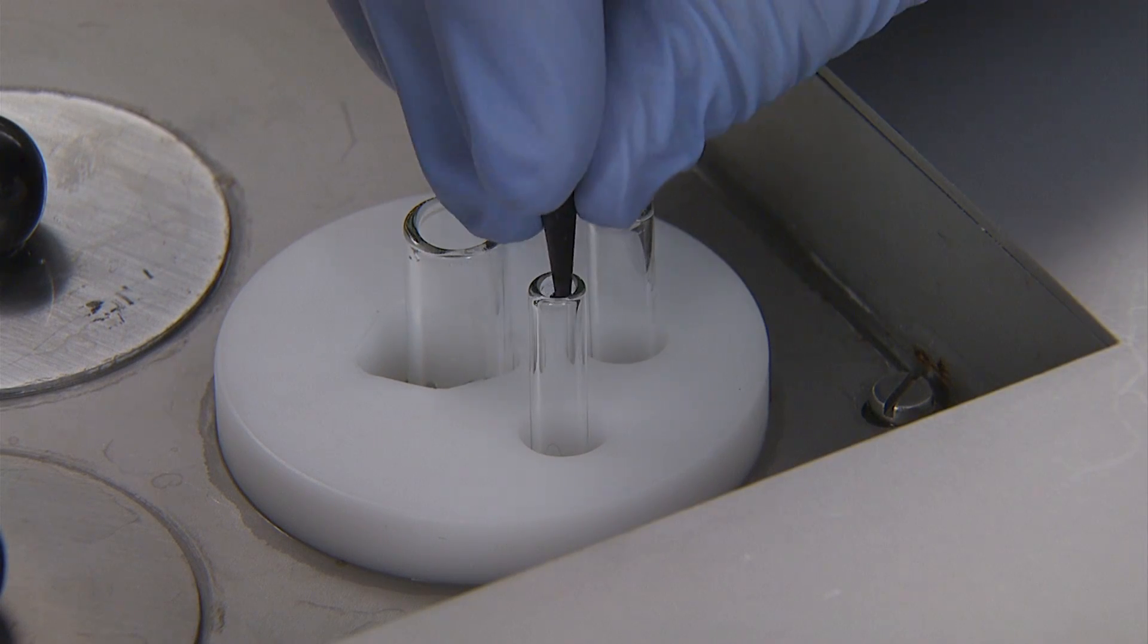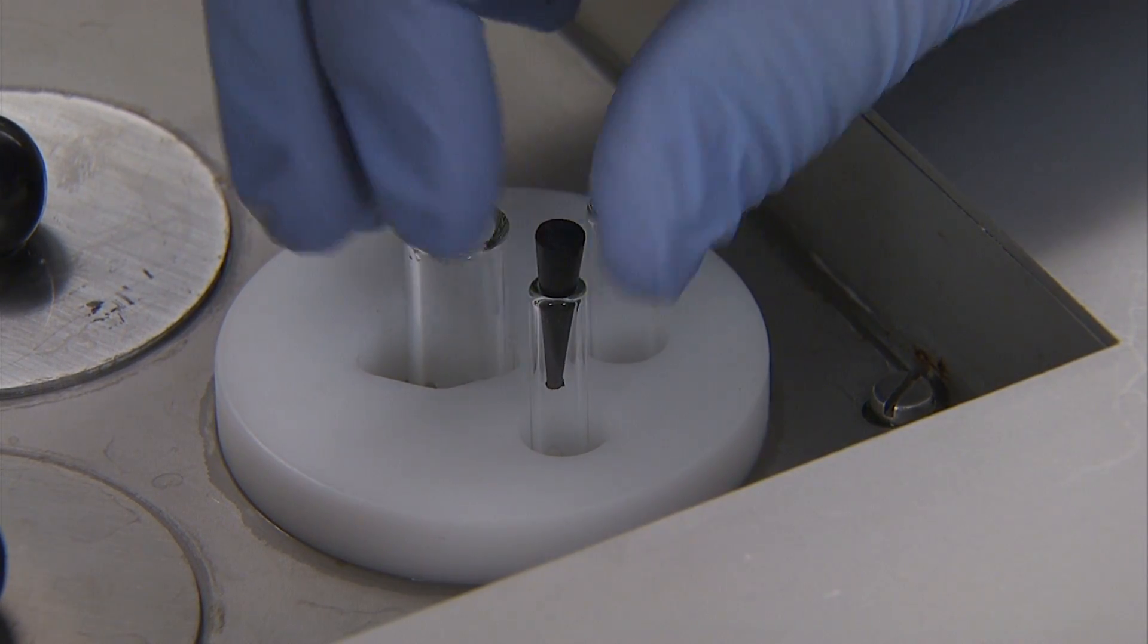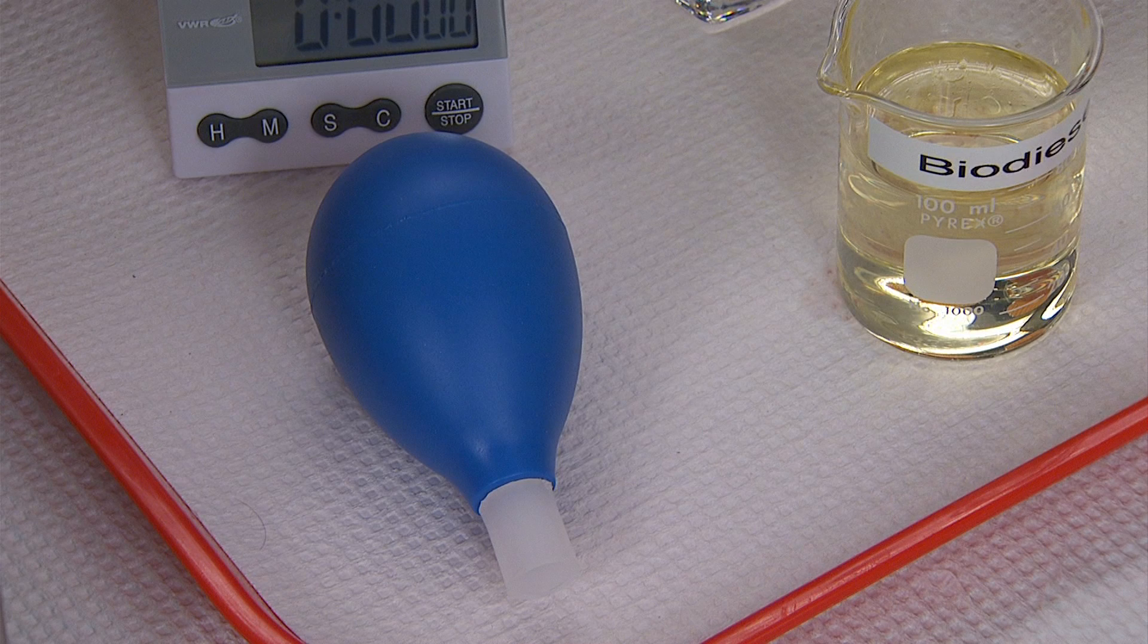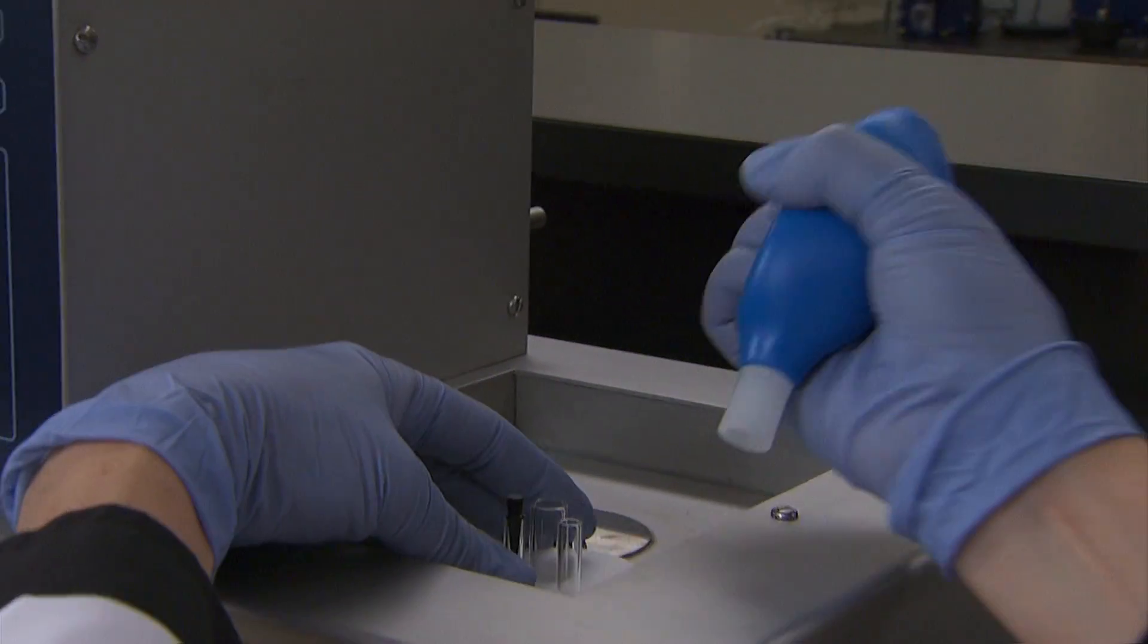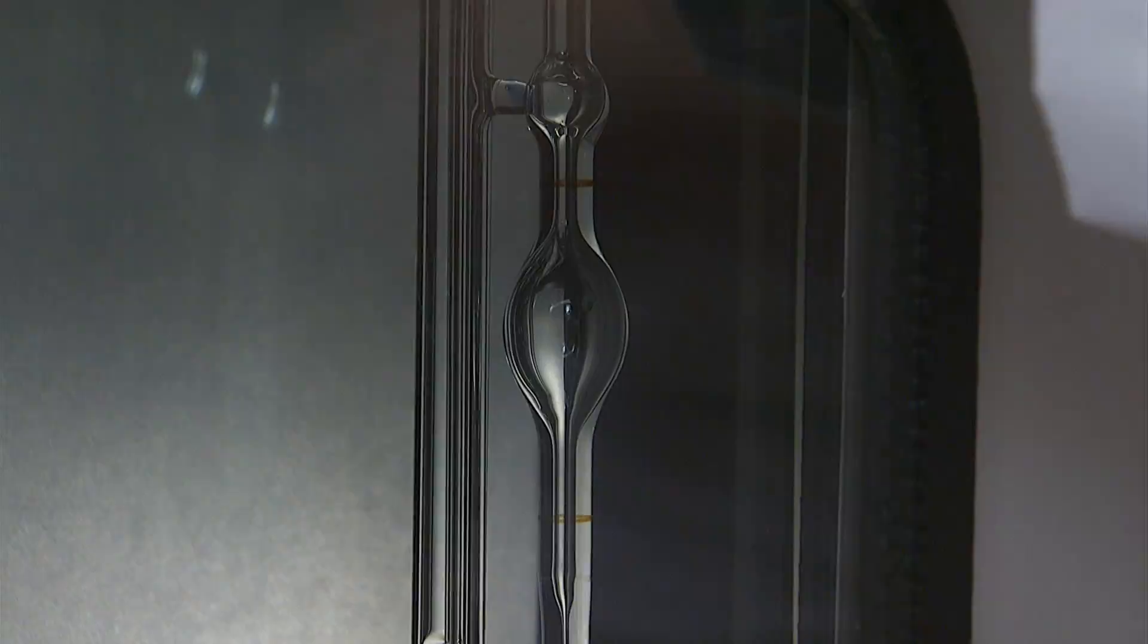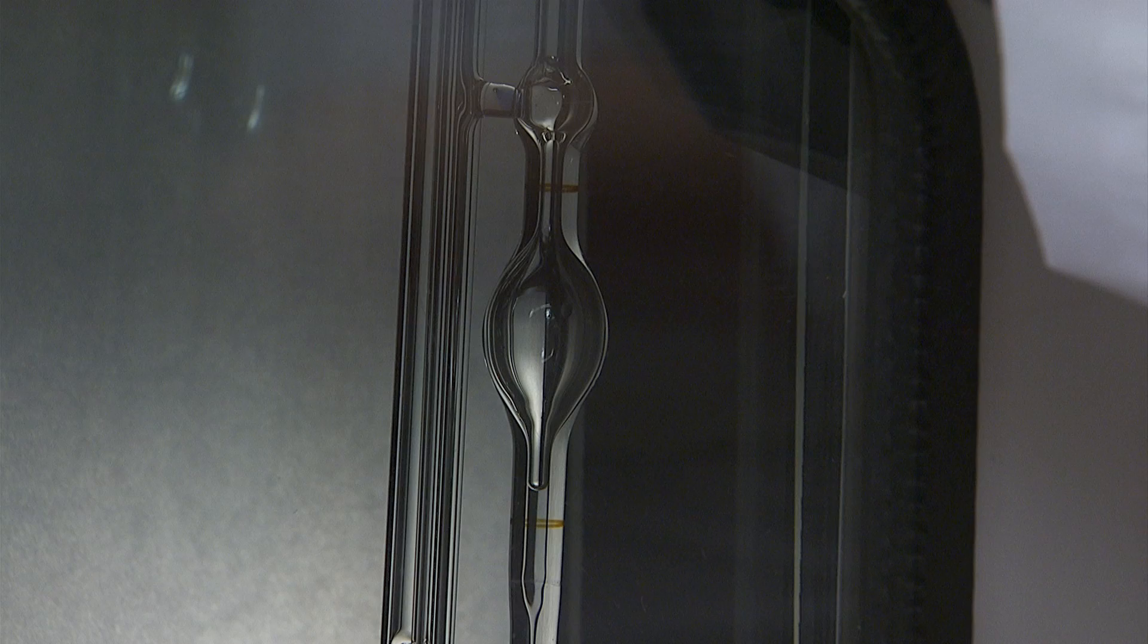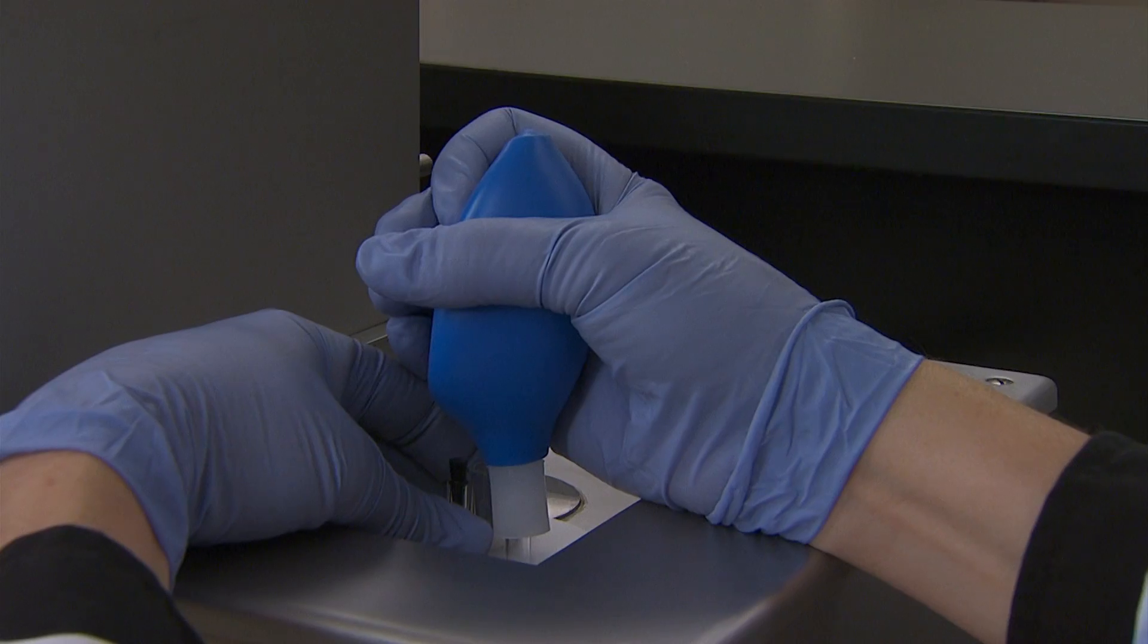Use a stopper to carefully plug the smallest tube portion at the top of the viscometer. It will be the tube in the middle out of the three glass tubes. With a pipette bulb or another suitable suction device, carefully charge the viscometer by drawing the sample liquid into the measurement tube. This is the tube on the right when facing the bath and it has a small bubble in the glass with line markings above and below the bubble. The liquid must be drawn above the higher line.